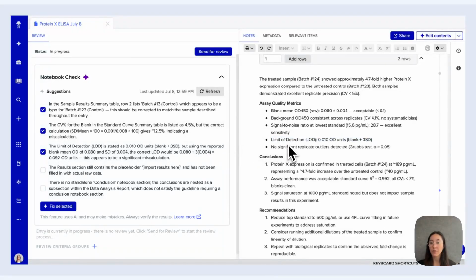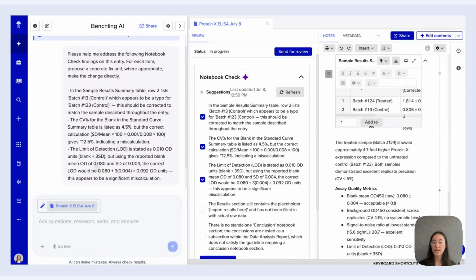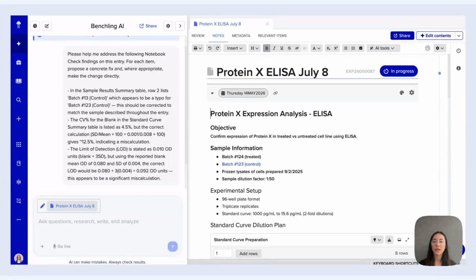Instead of having to actually manually go through and make all the calculation changes or edits, I can actually go ahead and select the suggestions. So you see that I've selected the three here and click Fix Selected. What this does is it sends the suggestions that were generated by Notebook Check into the chat agent, and the agent will then be able to apply those corrections and suggestions directly to your notebook entry. I'm going to just return the split workspace back to what it was before so we can actually take a look at the entry edits that the agent will make. I'll scroll up to the top and we'll give it a second to actually complete the changes for those suggestions, and then we'll check back in to confirm that those were applied.